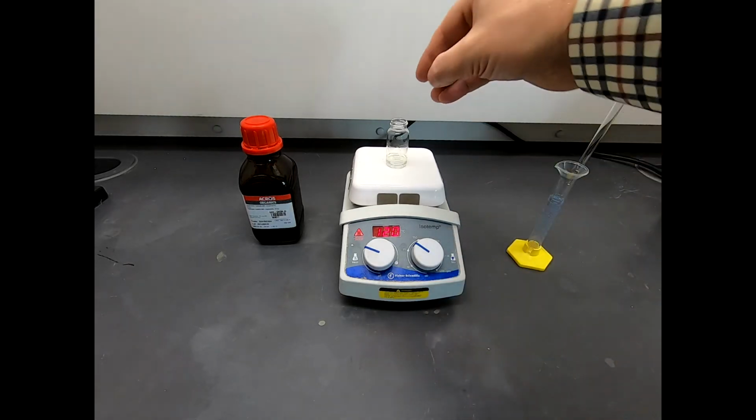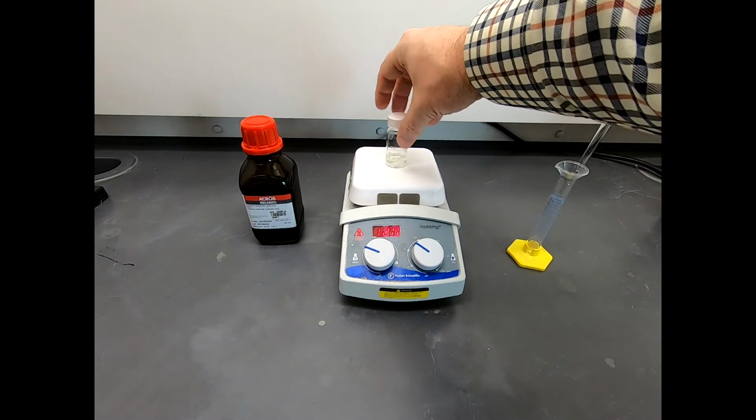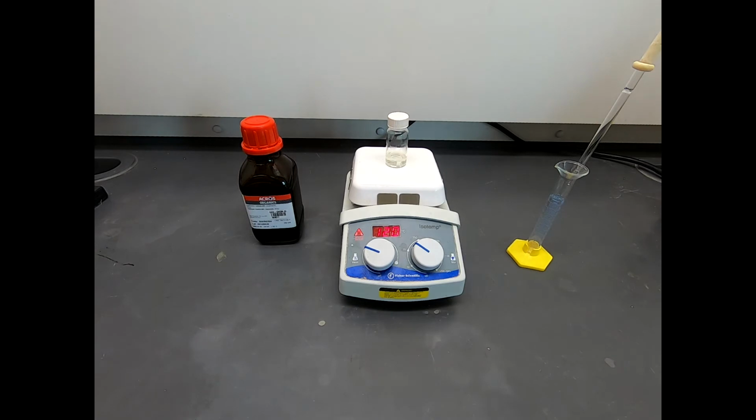Since this is warming up, I'm just going to gently place the cap. I'm not going to screw it down. I'm not going to seal it, because after all, it's heating. We don't want it to get hot and expand and generate pressure in there. So just by placing the cap on there, we're allowing this to interact with the environment and not build up pressure. But this is going to heat for about an hour, and then we'll come back and likely take a TLC and see if we're done.